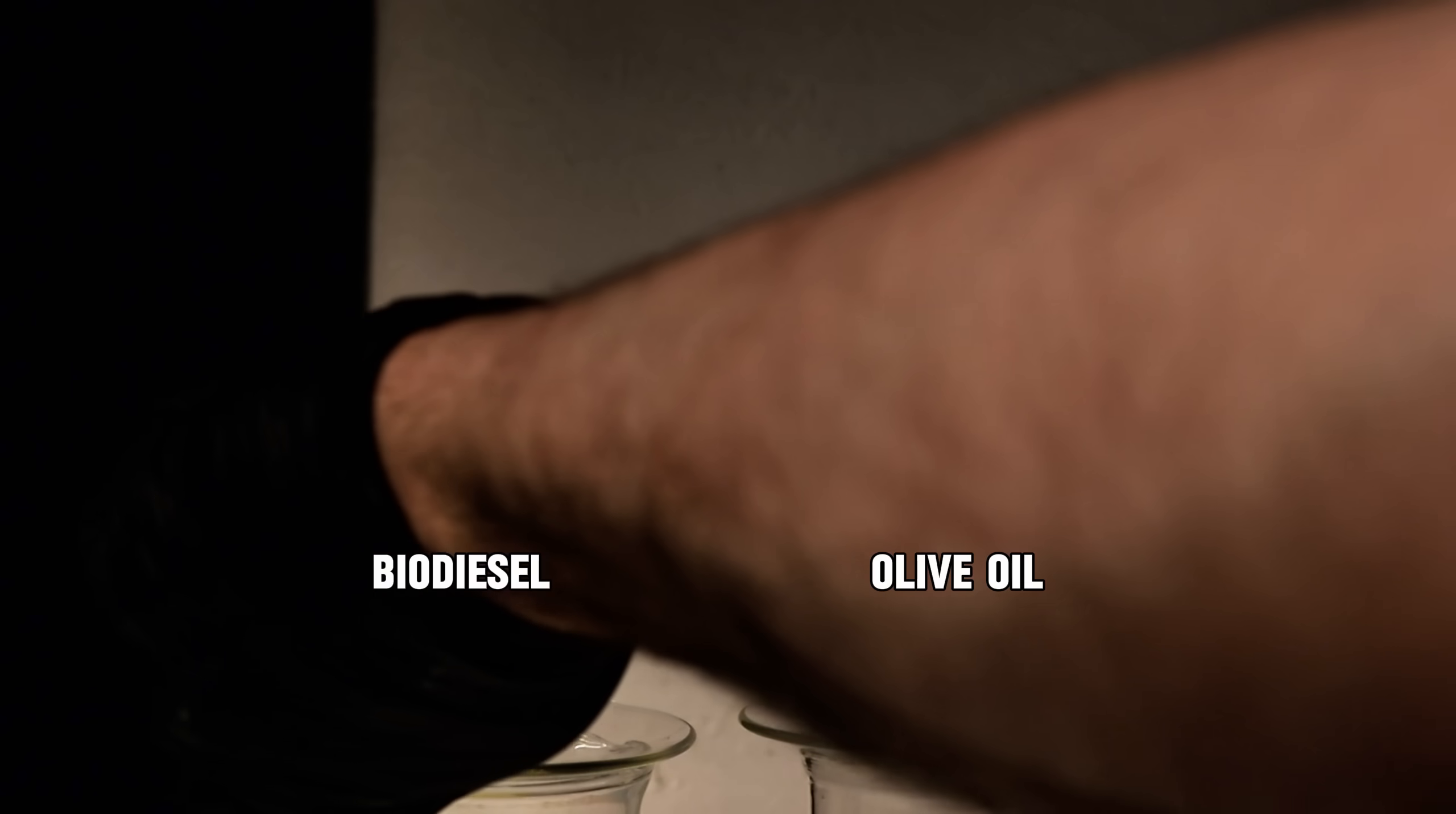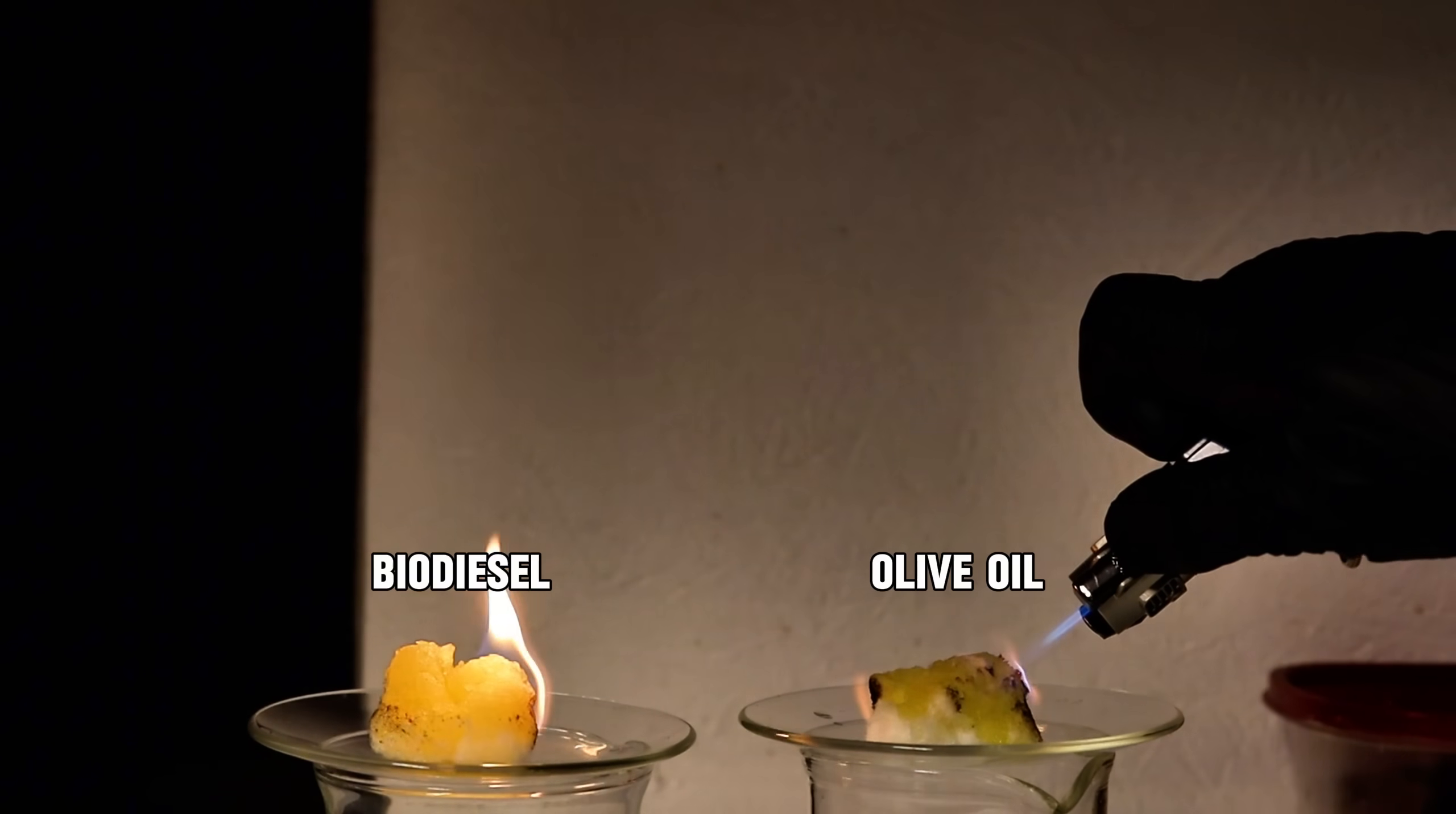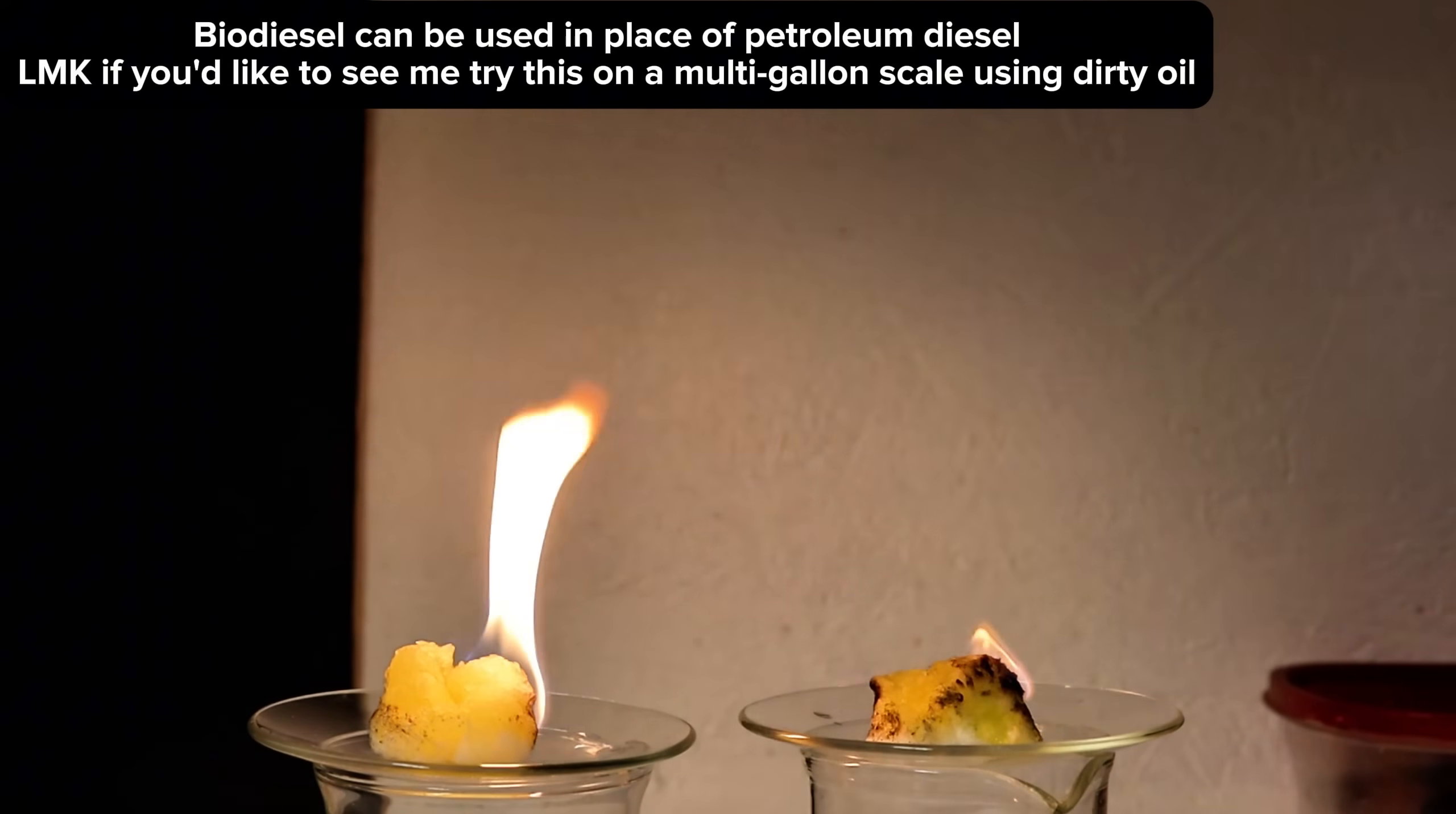As you can see, the biodiesel is dramatically more flammable than the oil and produces much more energy output over a much longer interval of time. Both put off a good deal of black soot as they burn, but the oil left behind dramatically more residue than the biodiesel by the time it finished burning.